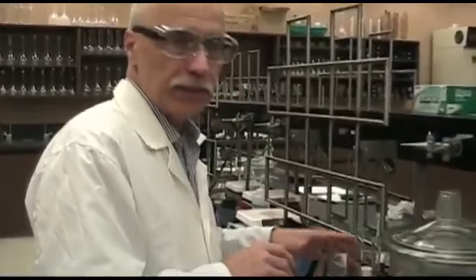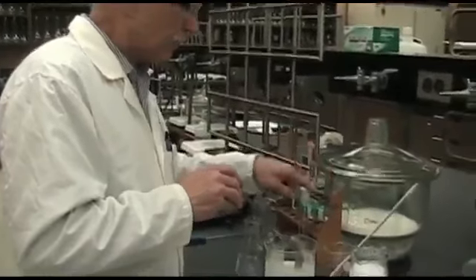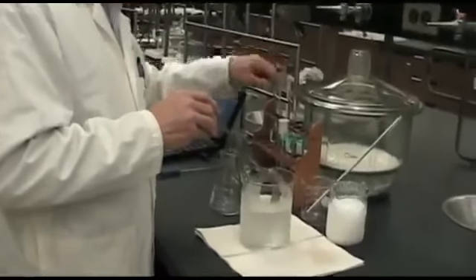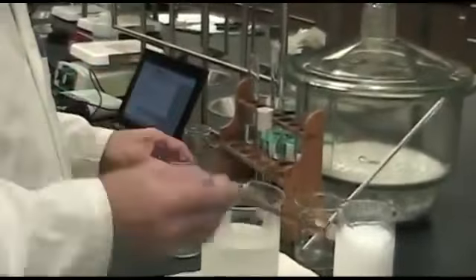Now we need something that's colder than 0 for our water solutions of sucrose, sodium chloride, and calcium chloride. So we will pour our ethanol into the Erlenmeyer flask, about 200 mL, and then we'll put our sodium chloride solution in our jacket as we did with the lauric acid.